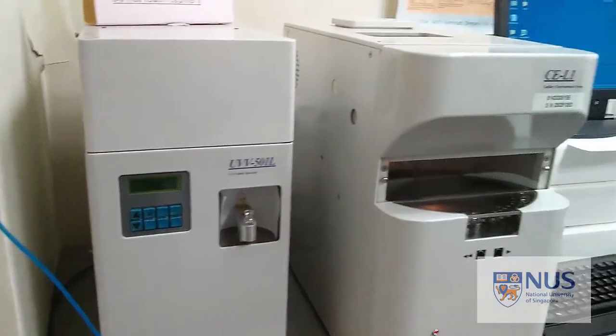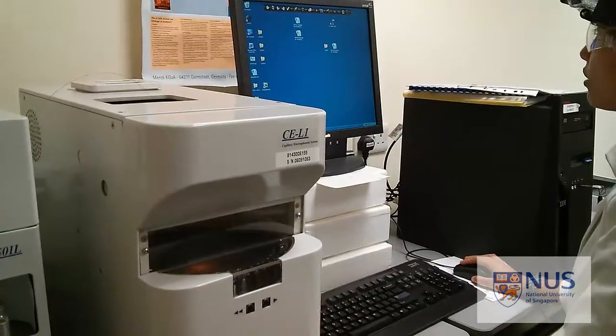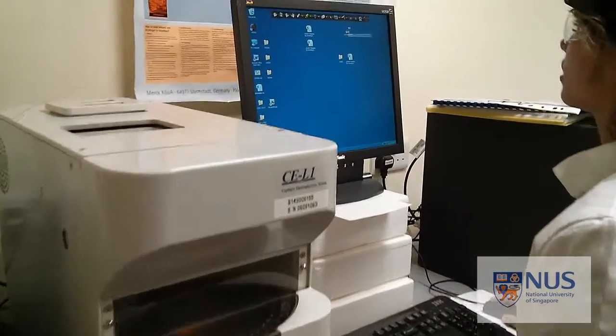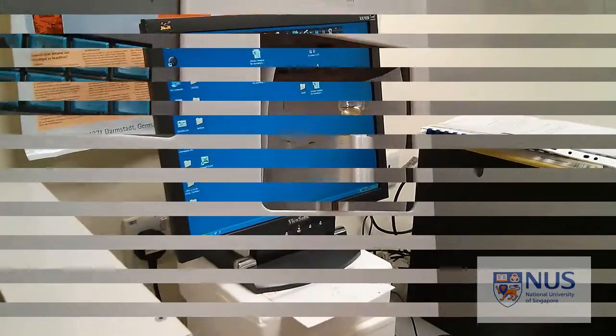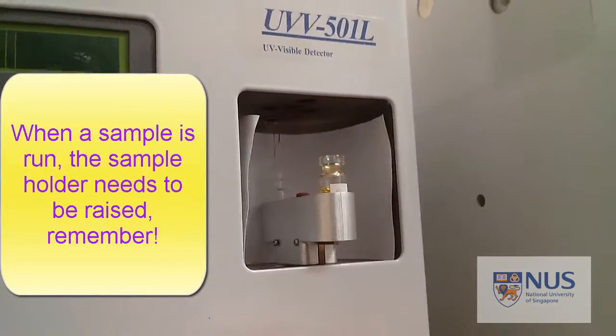So to start with, we need to wash the capillary tube to make sure that it's clean and ready for us to use. The software we're using is CE Station 9599. So just open this one.